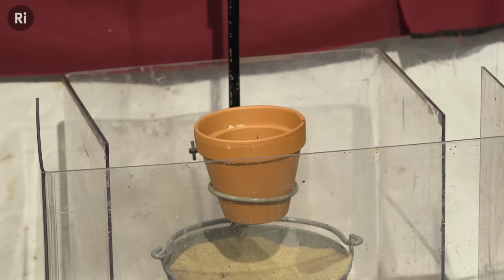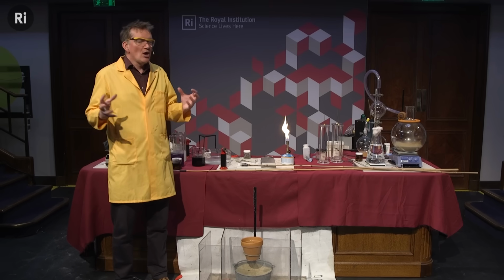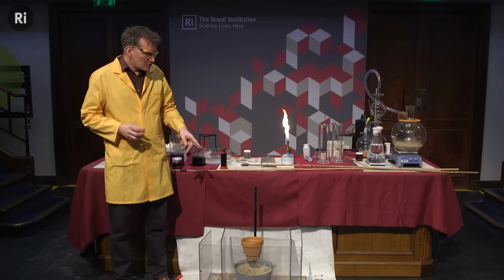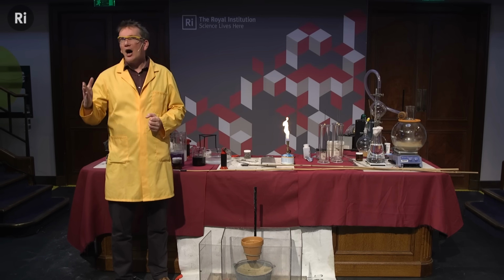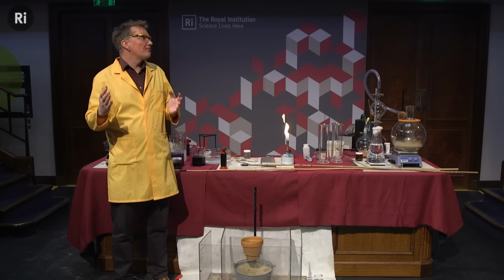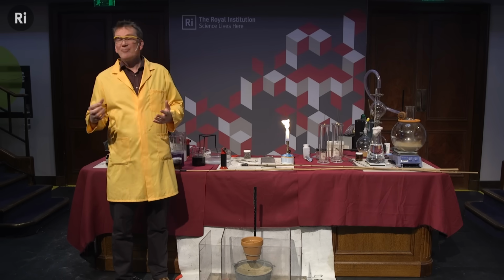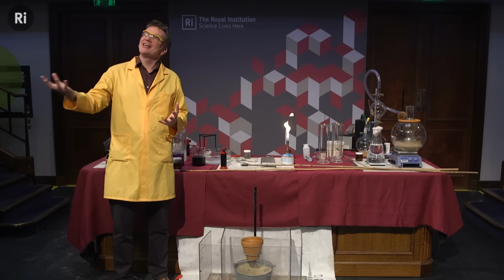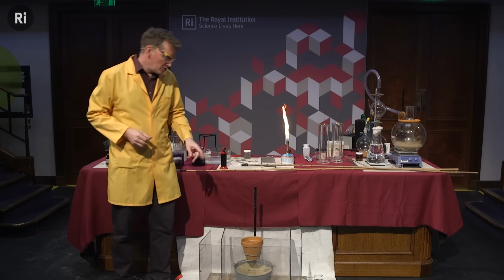Now, the aluminium really does want to combine with the oxygen. It is a very vigorous reaction when it forms the aluminium oxide. So what's going to happen here? The aluminium powder is going to steal the oxygen from the iron oxide, and this is going to form aluminium oxide. That's the driving force for this reaction. But the other byproduct of this is, well, if the iron oxide has had all the oxygen taken away, we're going to be left with iron. So we should be making some iron.